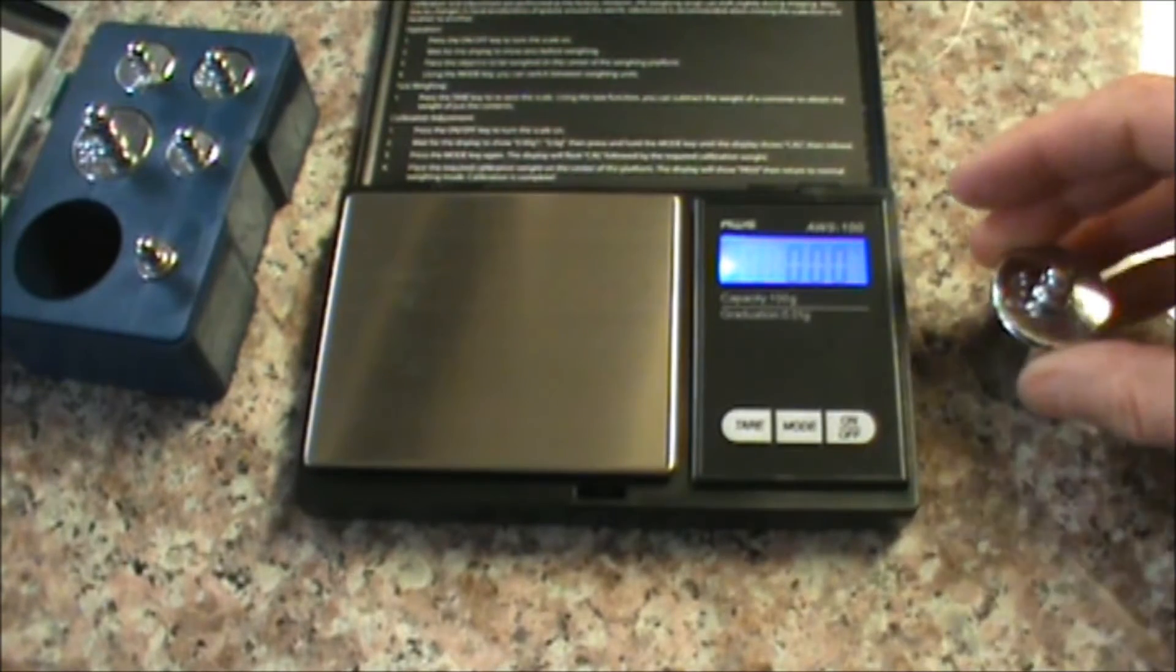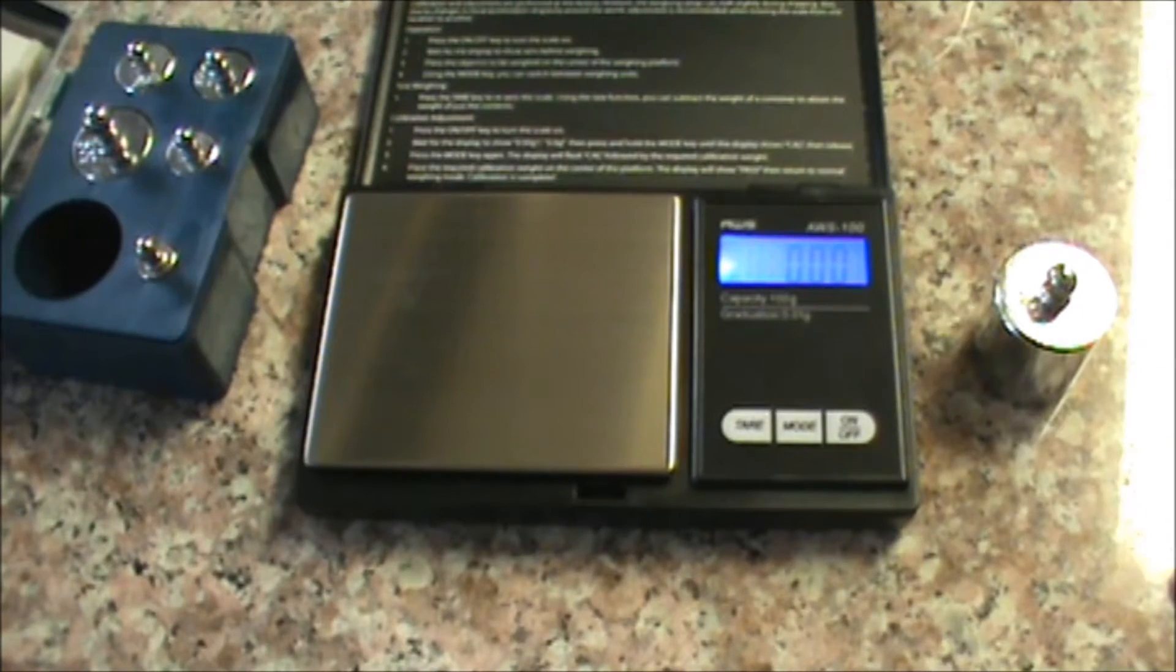You don't have to calibrate your scale each time, but I prefer to because I'm dealing with such small quantities.